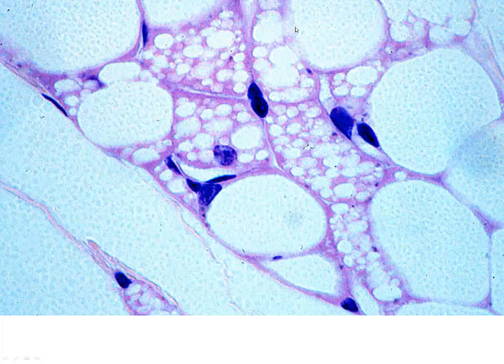All of these, in fact, are unilocular. But these are our multilocular. You see how the same appearance to these, but the vesicles are much smaller. And there's many more of them. So this is our brown fat, multilocular. This is our white fat, unilocular adipocyte.